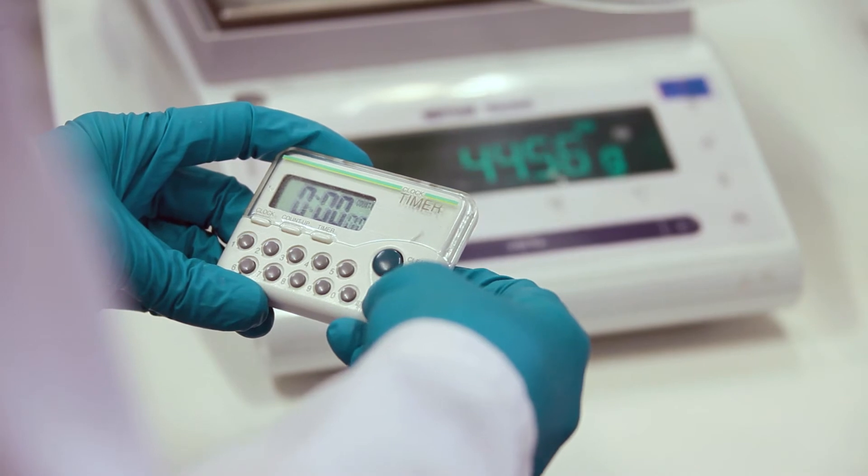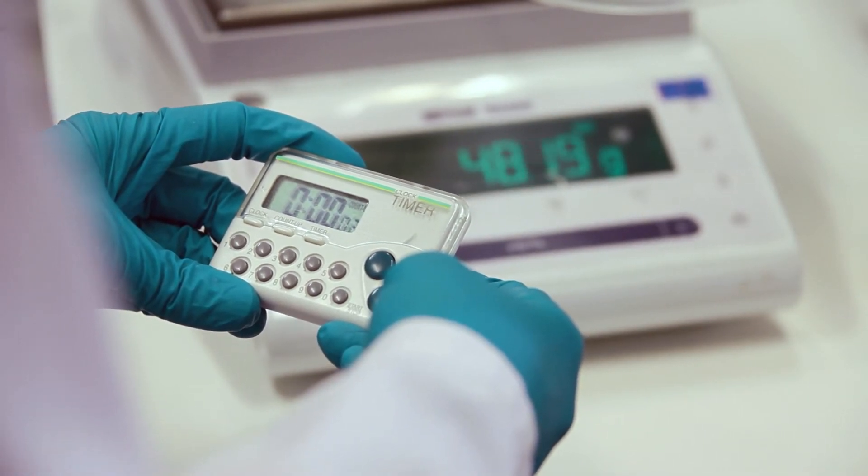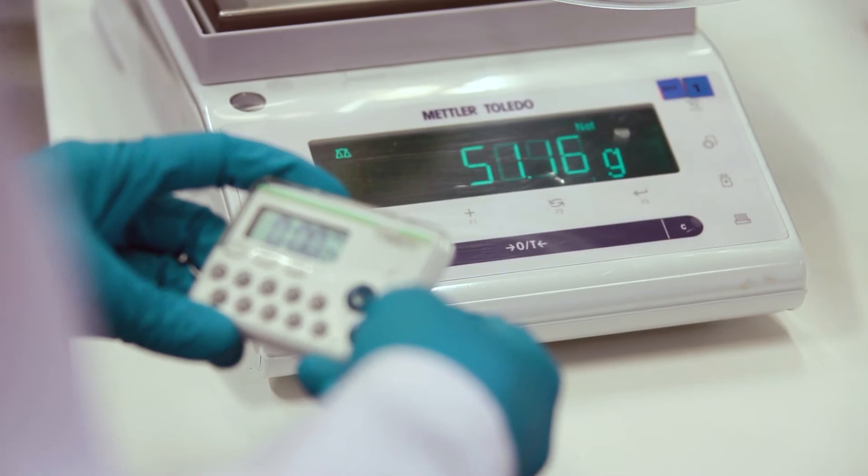When the flow is stable, record the weight and start the timer. After some minutes, record the weight again and calculate the flow rate.